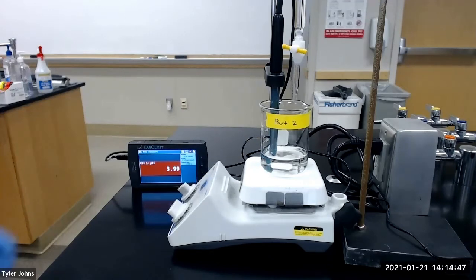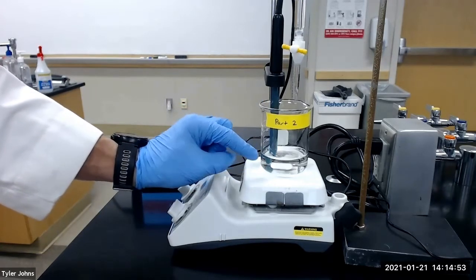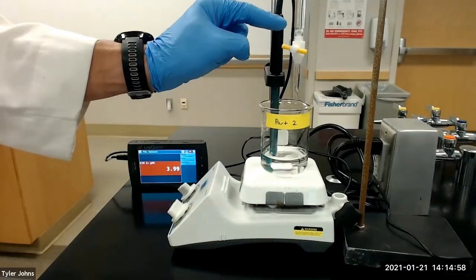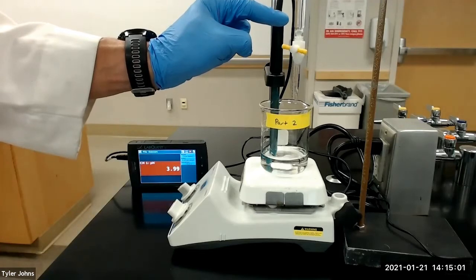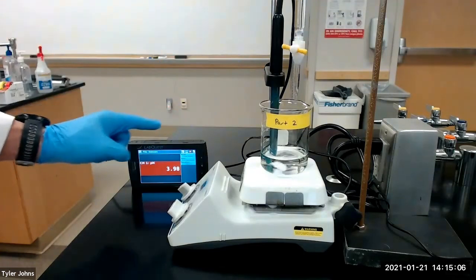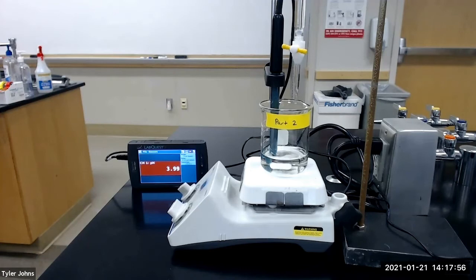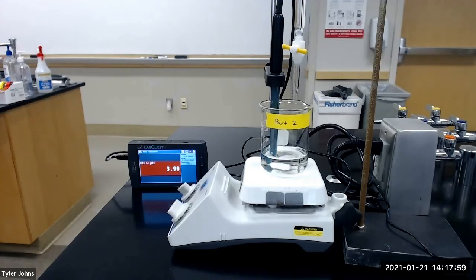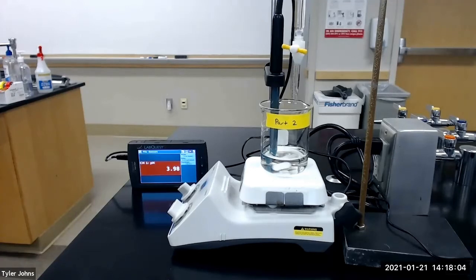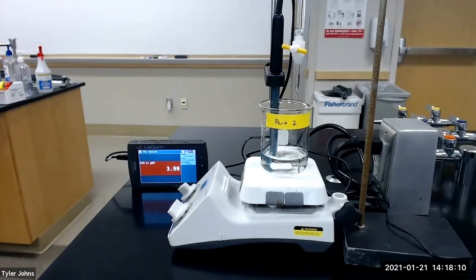Our titration apparatus consists of a magnetic stir plate, our 250 milliliter beaker with our acidic solution, a magnetic stir bar, our burette filled with the standardized 0.09955 molar sodium hydroxide solution, and a pH sensor which we will use to monitor the pH throughout the titration. We are now ready to collect our titration curve. While stirring slowly with the magnetic stir bar, we will titrate the acid with the standard sodium hydroxide solution, making sure to record the pH and milliliters of sodium hydroxide after each addition of titrant.